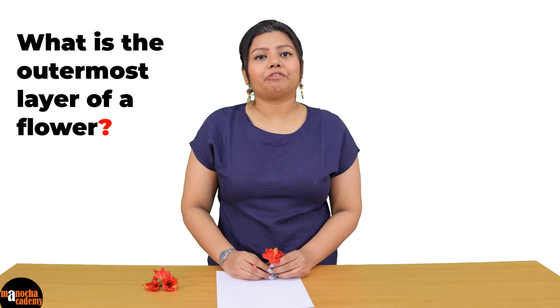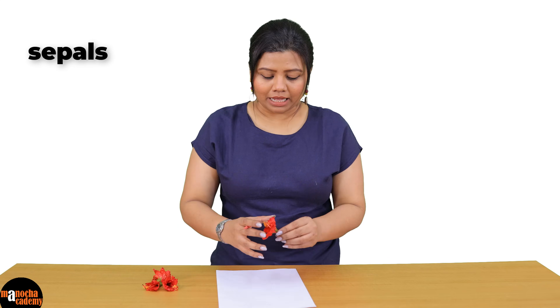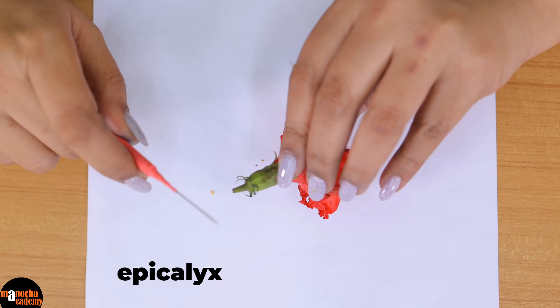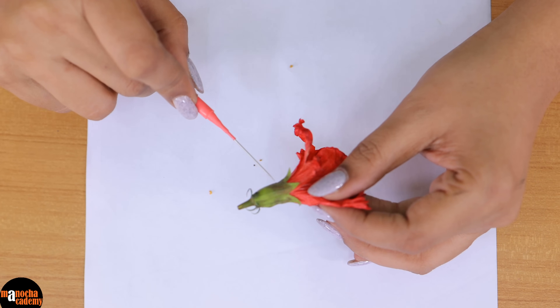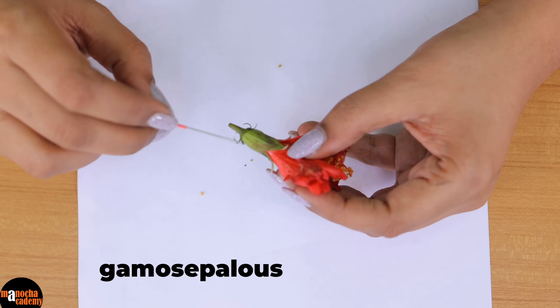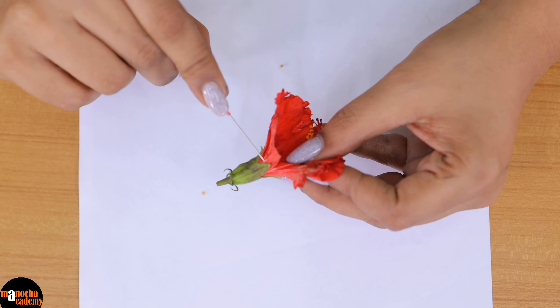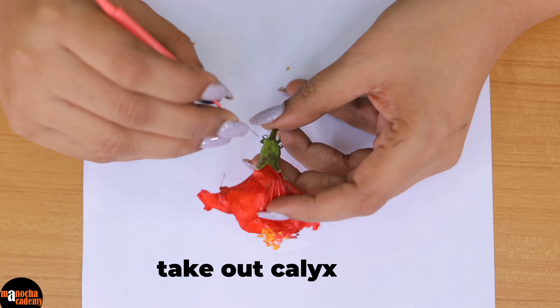What is the outermost layer of a flower that you see? In a flower the outermost whorl is called sepals — the entire whorl is called calyx and the members are called sepals. Now if you see this flower, these are the epicalyx. The epicalyx is the part that we are not going to take out. This is the stalk of the flower and this green layer is the calyx which consists of five sepals. This flower is gamosepalous, which means all five sepals are fused to form a continuous column. Although the tip is free, they are fused towards the lower end. So our first job is to take out this calyx.